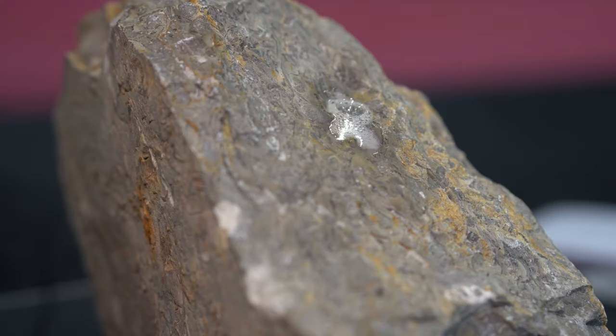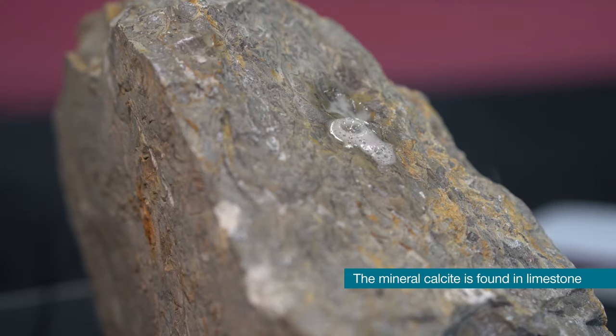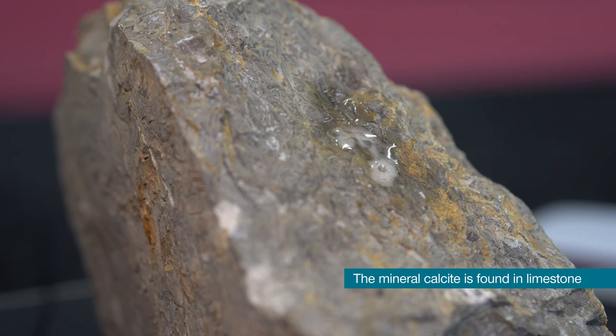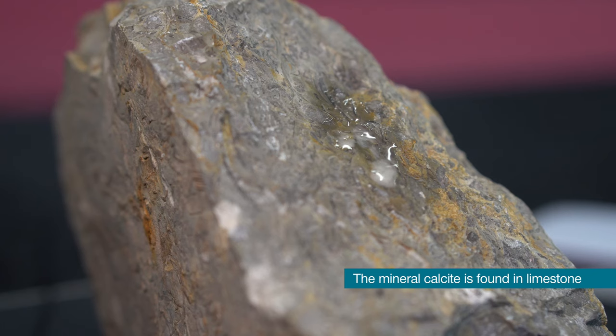If the rock contains a carbonate mineral such as dolomite or calcite, the hydrochloric acid will react with that mineral and produce carbon dioxide.